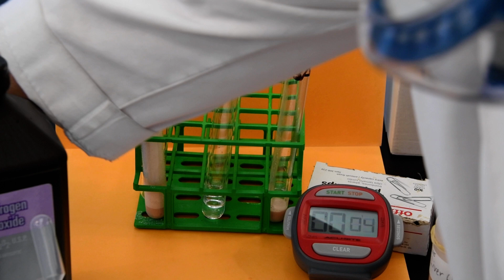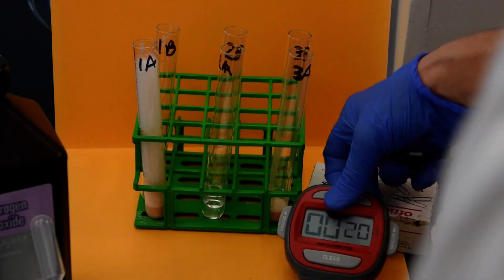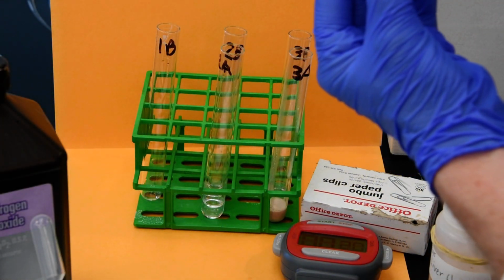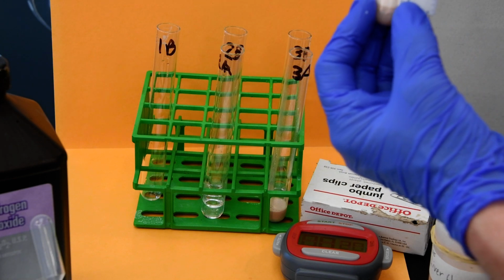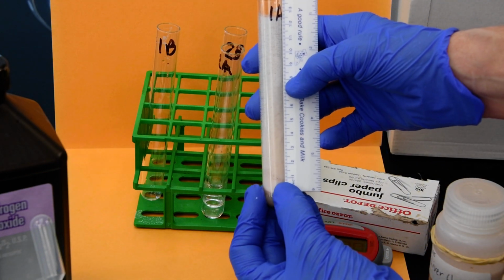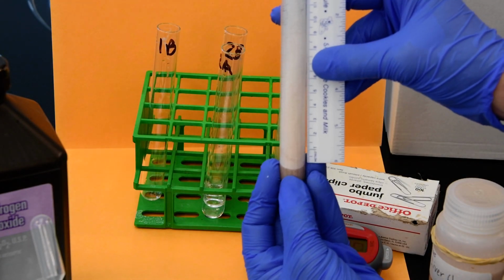And here's how we're going to record results. Sorry, I'm all over the frame. Is that still in focus? No, you're out of range. Okay, am I in focus now? There you are. Okay. Let me get down here and try to be steady. Your head's in the way.